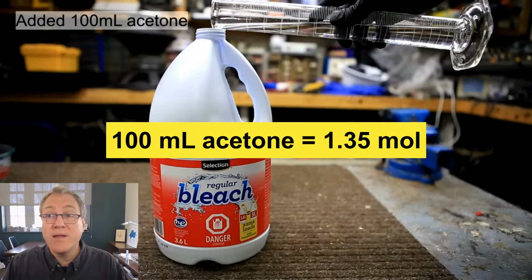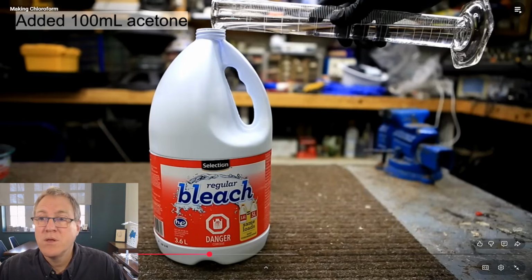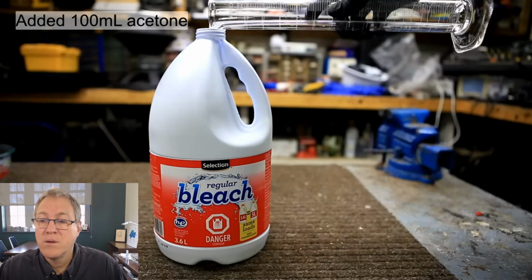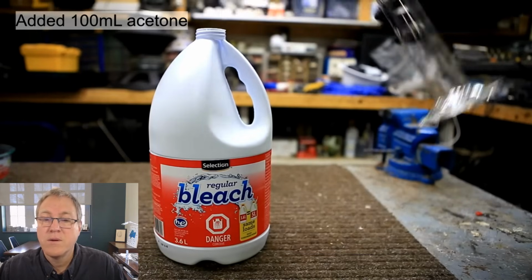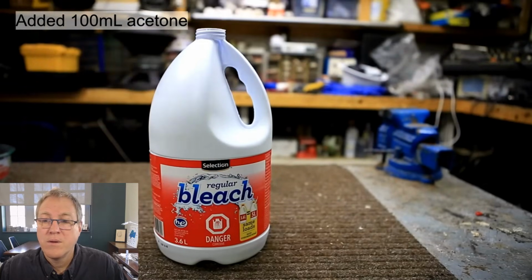So if he put in 1.35 moles of his limiting reagent, and every mole of acetone can form a mole of chloroform, then his theoretical yield is 1.35 moles of chloroform. An excess between 3 to 5% is better, and 11% is much too high. We use an excess of bleach because we want to make sure that all of the acetone is consumed. Any leftover acetone could form a difficult to separate azeotrope with the chloroform.